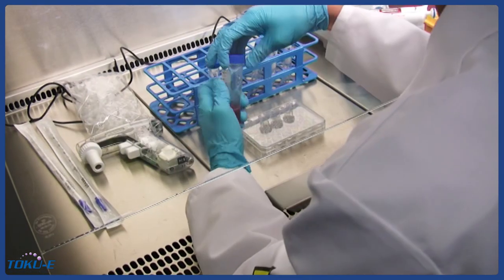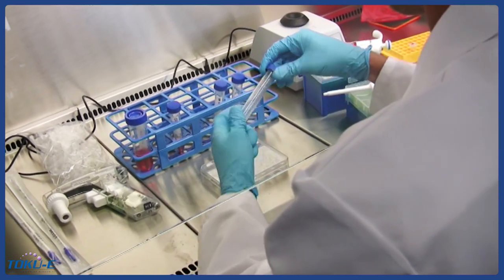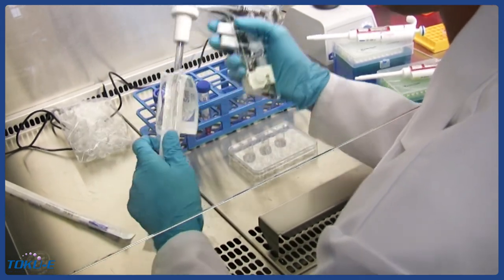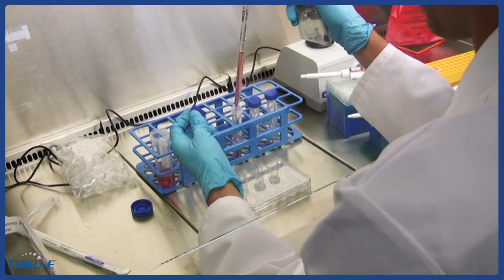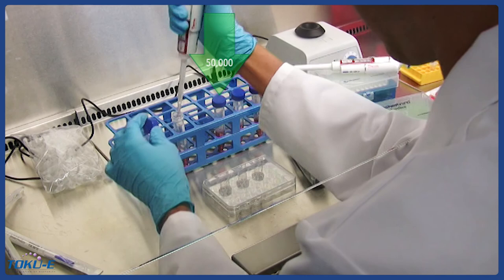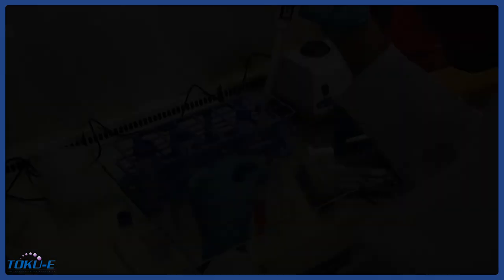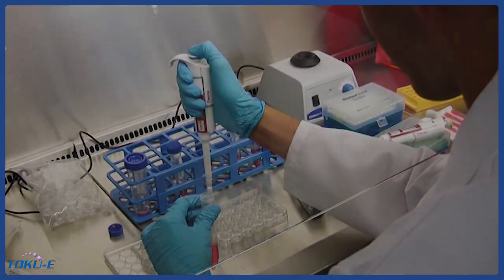First, we will seed parental cells at different densities to determine the cell density that gives us 80% confluency the next day. This cell density is ideal for transfection as the cells are in the proliferation stage and growing exponentially. Add 5 milliliters of culture medium to 3 15-milliliter tubes. Dilute the parental cells at a concentration of 50,000, 100,000, and 200,000 cells per milliliter. Add 500 microliters of each cell suspension to 8 separate wells of the 24-well plate according to this scheme.